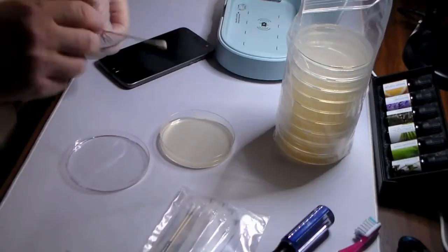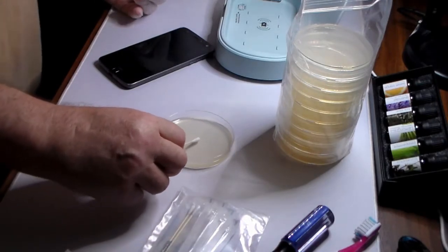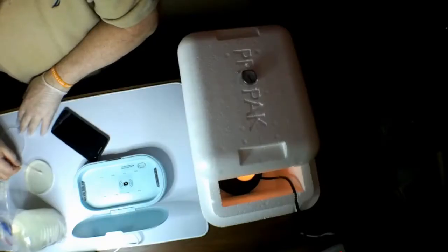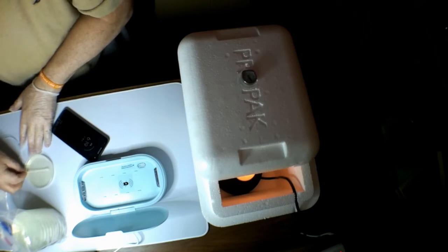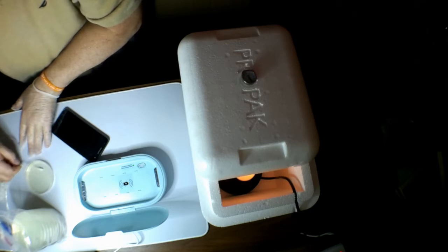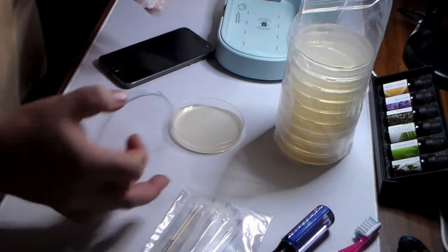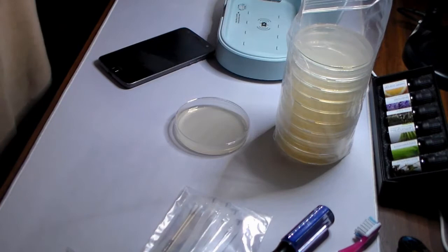Now it says to touch and roll the swab in the middle of the agar and be careful not to tear it. Then to draw radial lines from the center to the edge, and then fill in the rest of the space, and be careful not to tear the agar. Alright, this is now soiled and trash. And we have our first petri dish down. I'm going to go ahead and take the glove off.